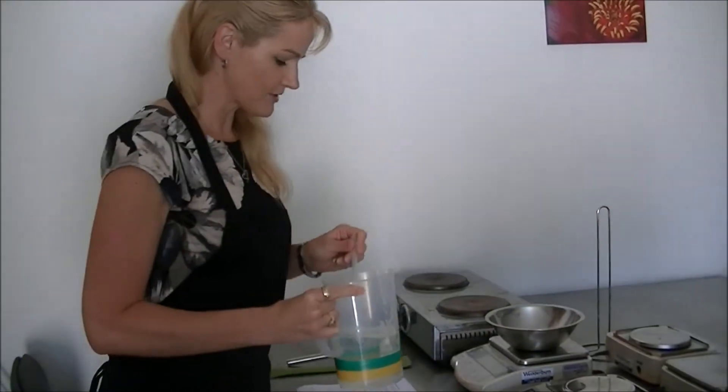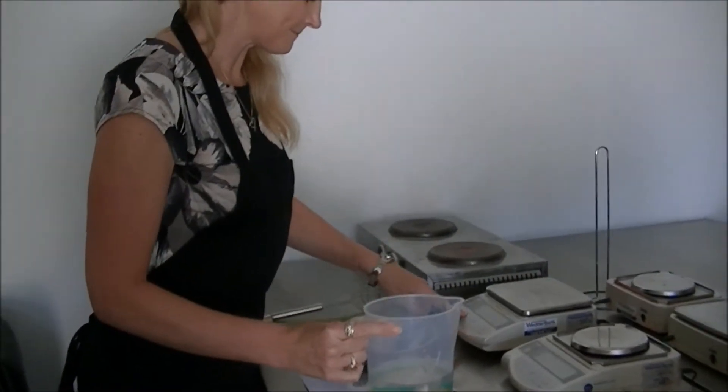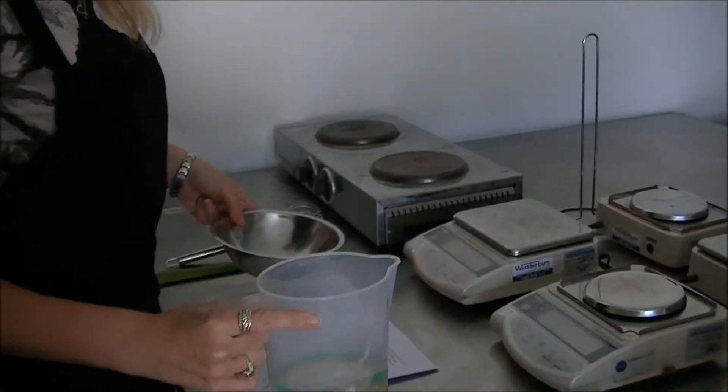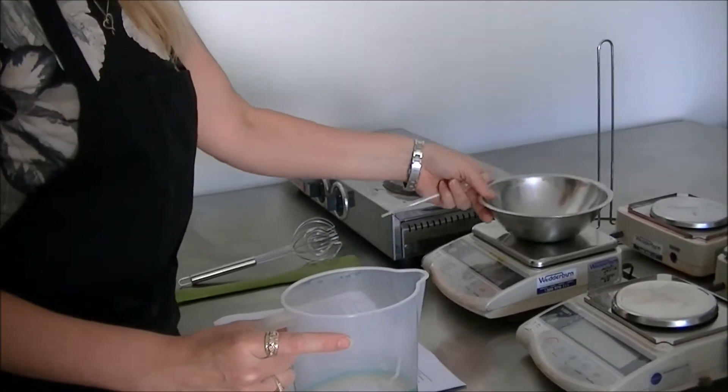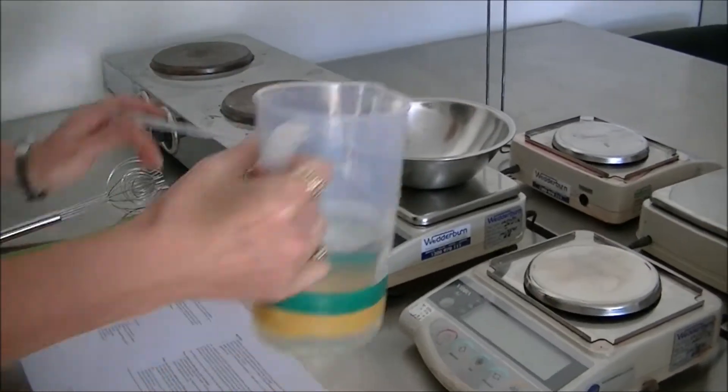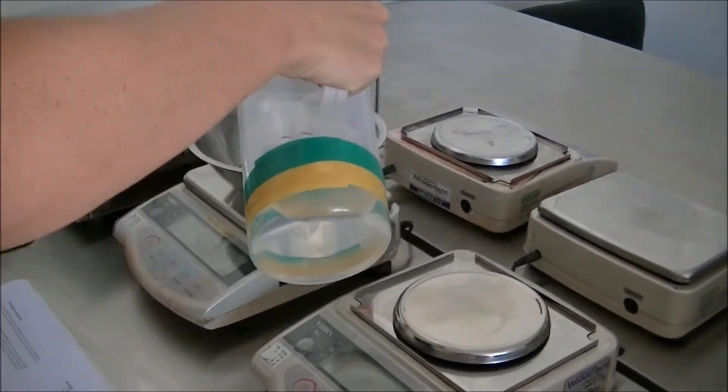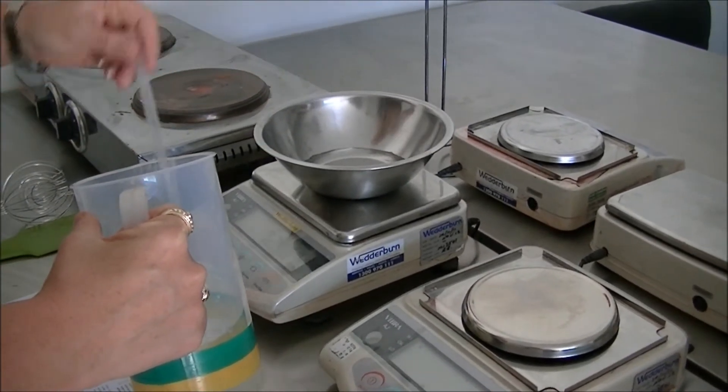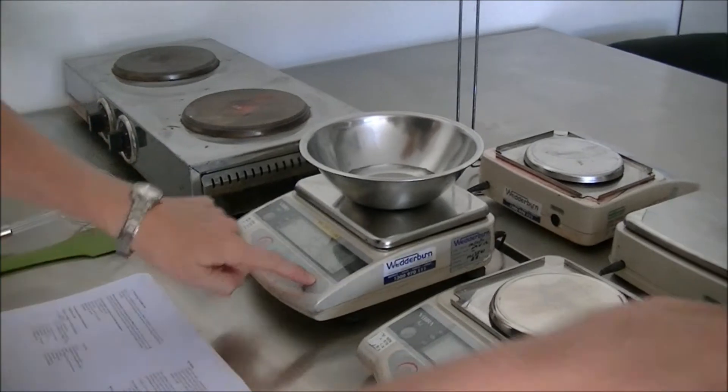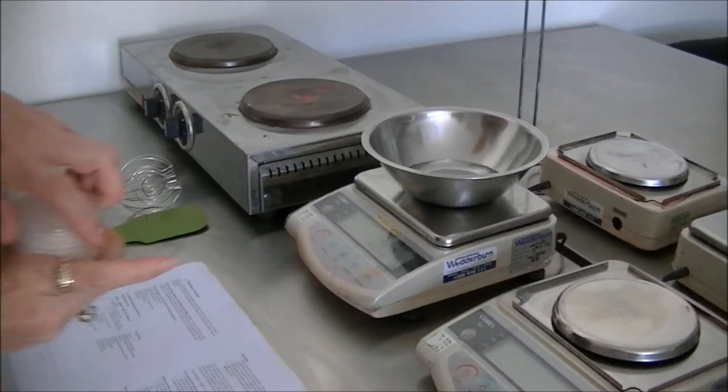So first of all we're going to start by measuring out the water. And to this I'm going to add the sodium lauryl sulfate. Now this is a 90% concentrate.